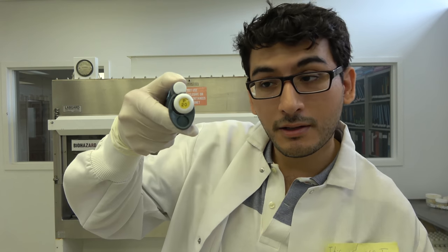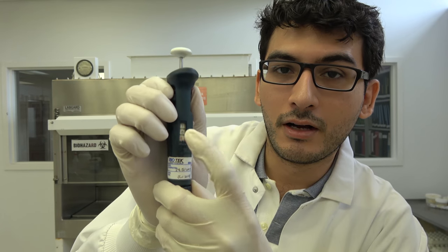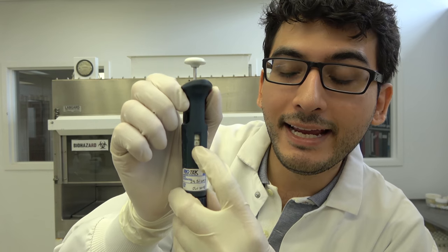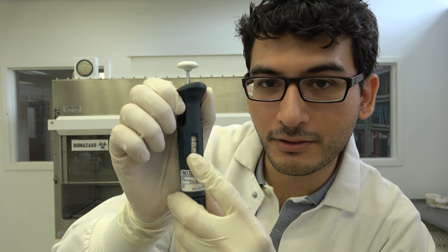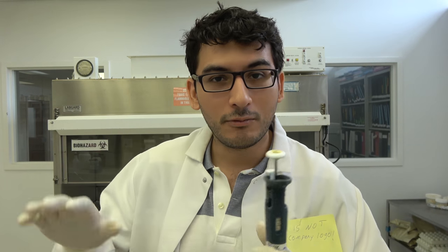So I'll give you some examples on how to read these, because not all of these are the same thing. For example, this says P20. What the fuck does that mean, Scotty McEaster? This means that it could only draw up to liquid of 20 microliters. And so whatever you fucking do, don't be that asshole who tries to move it to like 21 microliters, because you're going to fucking break it. So for some micropipetters, you'll notice a red number on the bottom. So since this is a P20, this reads right now 18.8 microliters. So that red number stands for the point whatever.